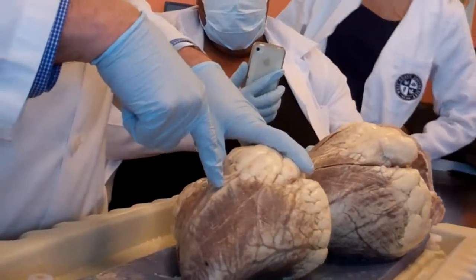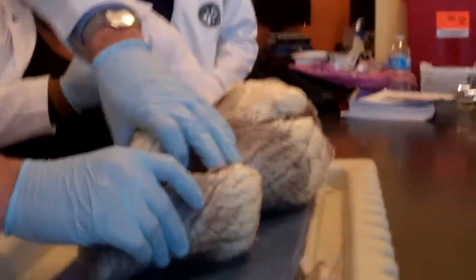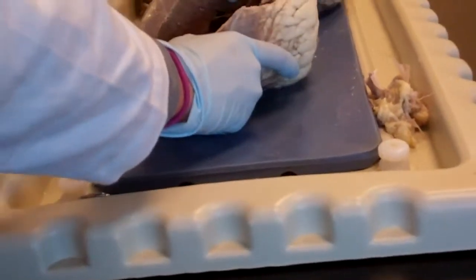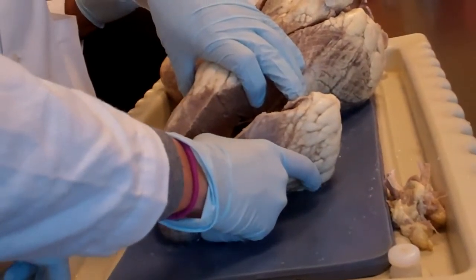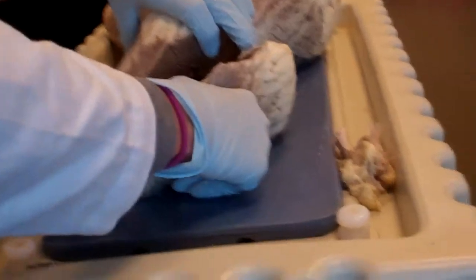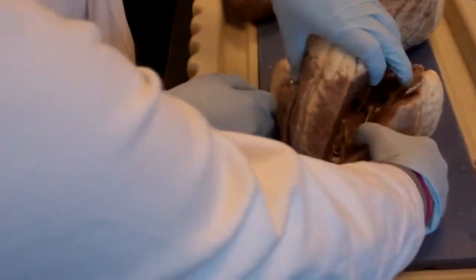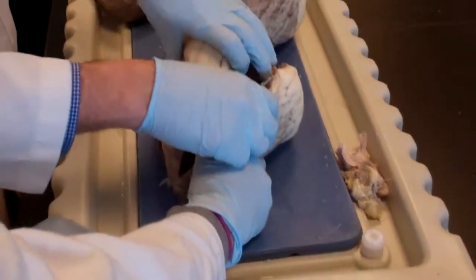Once this is correct, you're going to see, and I have my friend here, Elizabeth. Tell everybody how thick this is. It's pretty thick. Well, measure it. Absolutely. It's about 2 inches. Very good. So thick, then has to be the left ventricle.